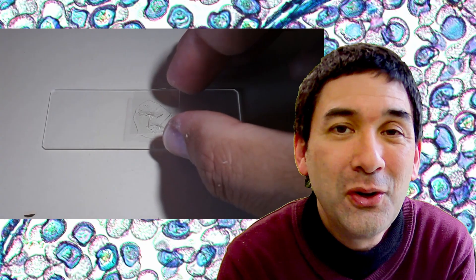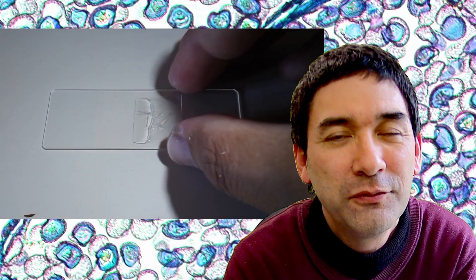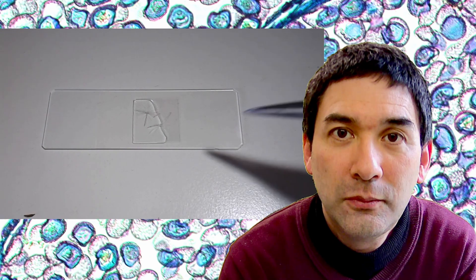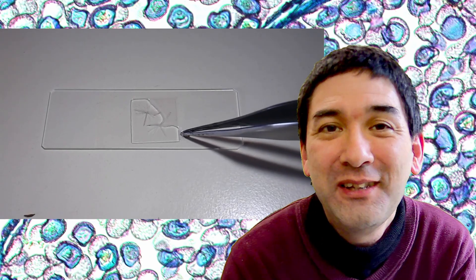I thought at that time the video was really great, but look at all the pauses and breaks—something I would have removed these days. Here I put a cover glass on top, and now finally you can put it under the microscope. Where's the microscope? I'm adding yet more water here. Evidently, the specimen was not thin enough.